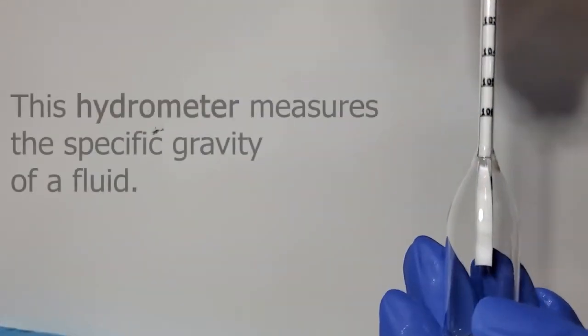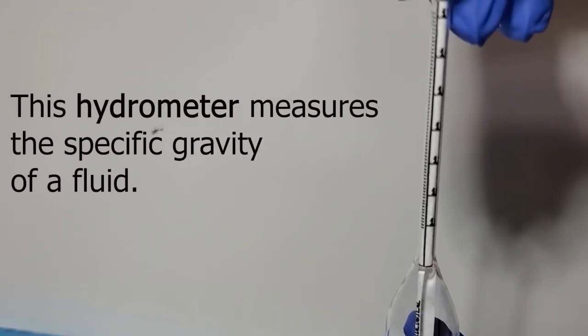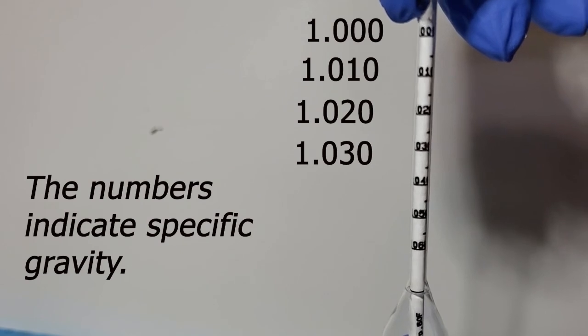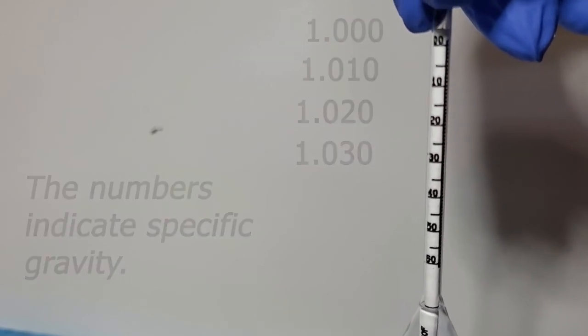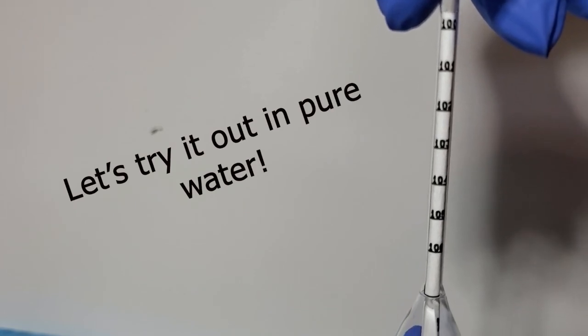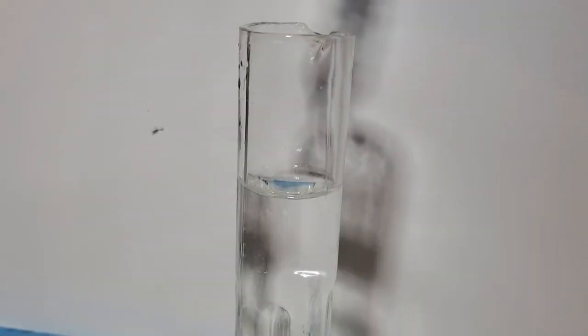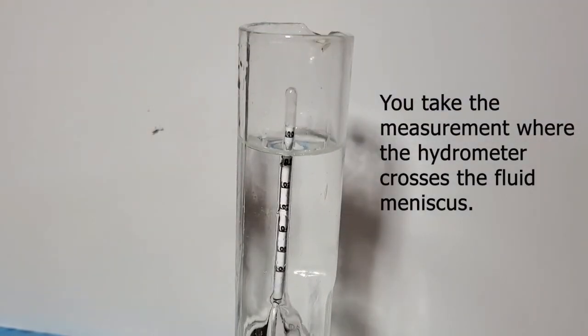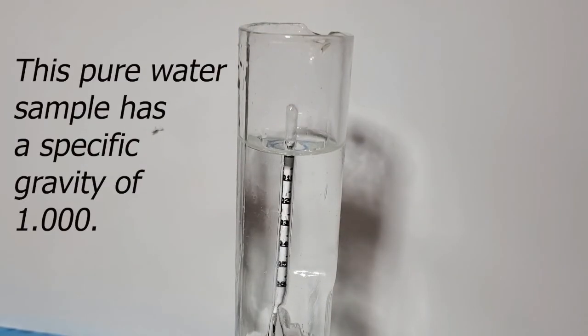We'll be using a hydrometer to measure specific gravity. That'll be indicated by the numbers that you see there on the stem. To demonstrate, let's try it out on some pure water. We float the hydrometer, and we read it where the meniscus hits the stem. Here you can see that the water has a specific gravity of exactly 1.000.